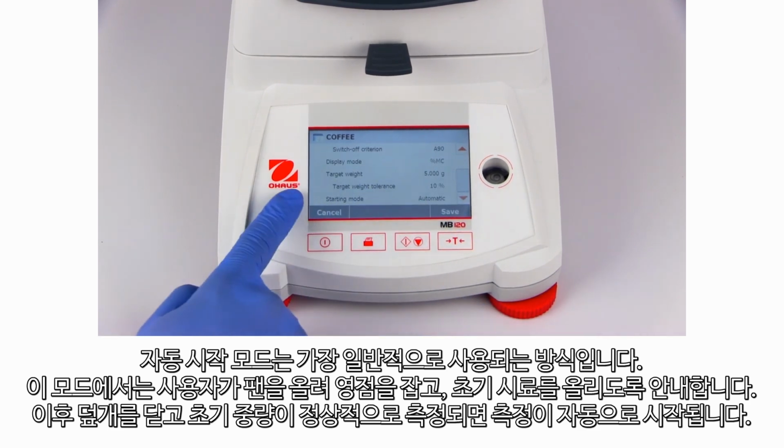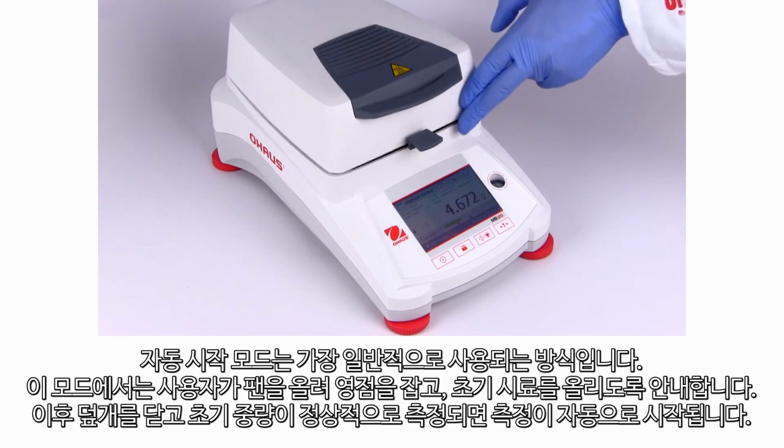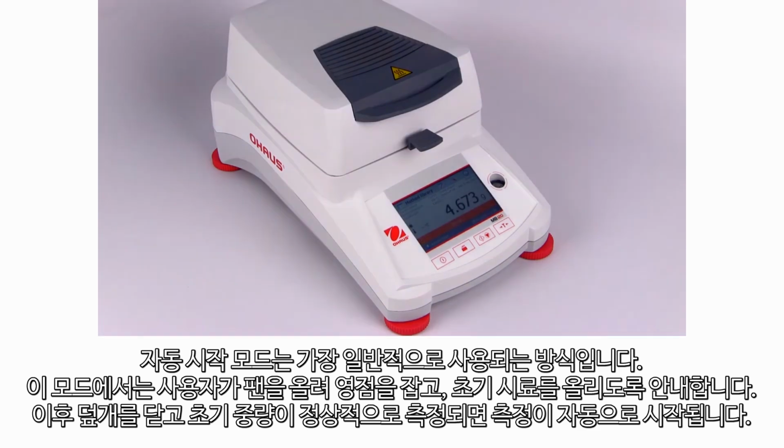Automatic start mode is the most common and will instruct the user to place and tare the pan, place the initial sample, and will automatically start the measurement once the lid is closed and an initial weight is successfully taken.